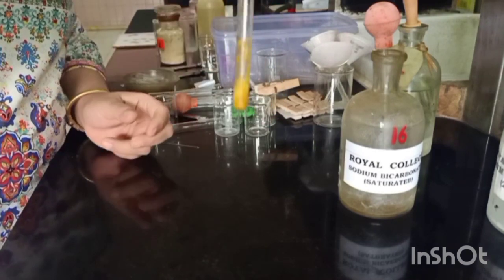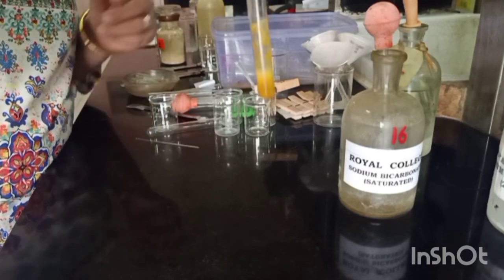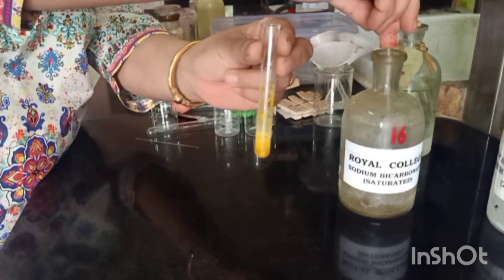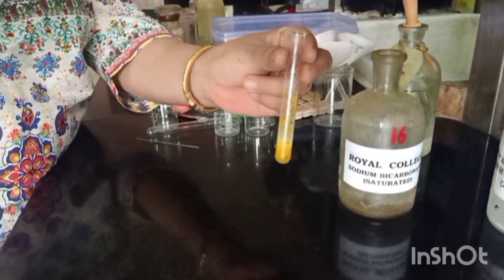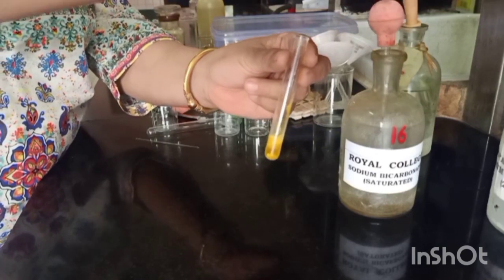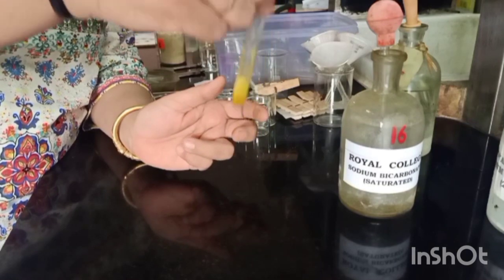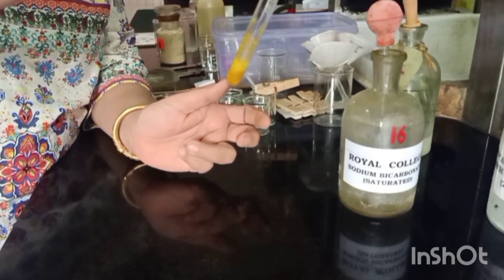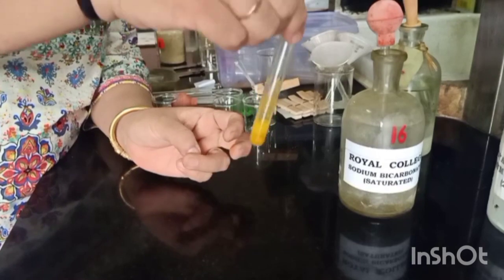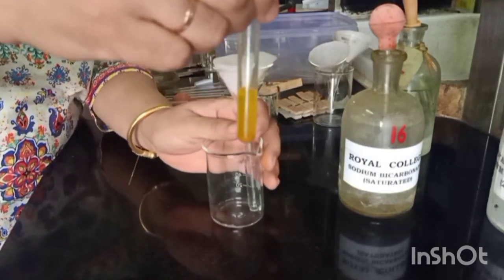So let's shake it vigorously and then proceed to filter. We add a little more bicarbonate because we are still seeing effervescence, indicating that an acid is still present. Let us now filter this.